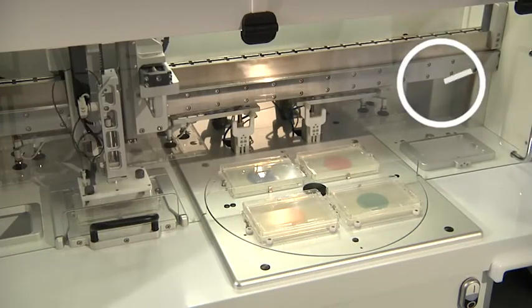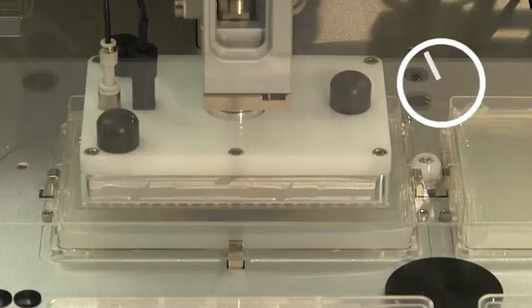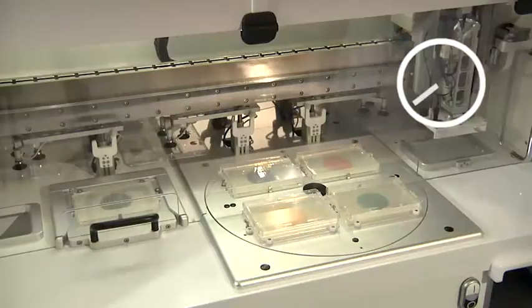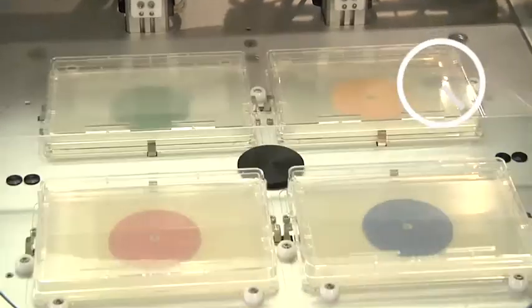With the help of the robot, we can rapidly pin thousands of yeast colonies onto multiple plates with different growth conditions.